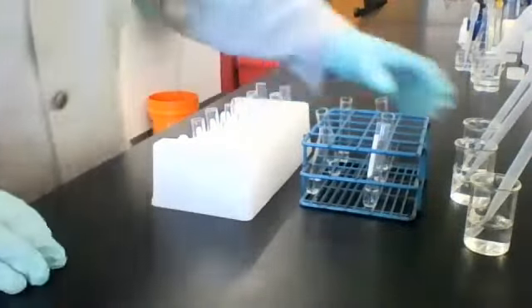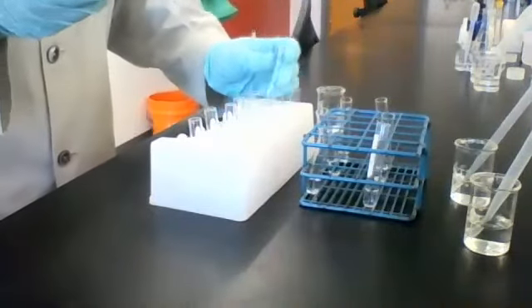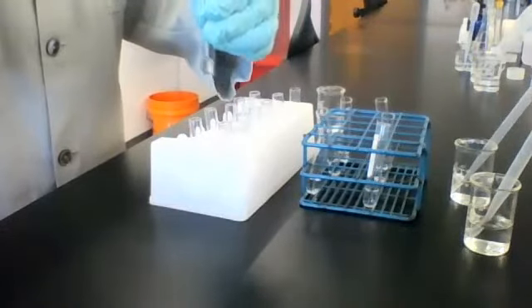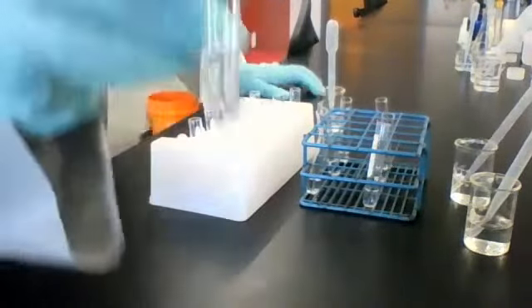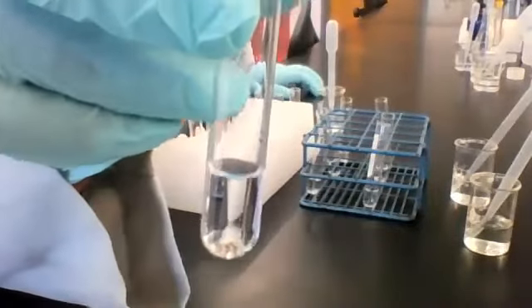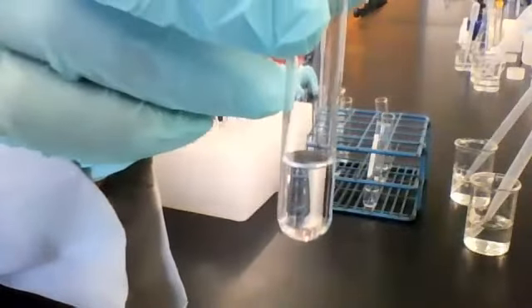All right, so let's start off with reagent A. I have it right here. So let's add some reagent A to solution 1, which is NaCl. Okay, can you see that? All right, so this time I'm not going to spell out what the observations are. Hopefully you can see what's going on.